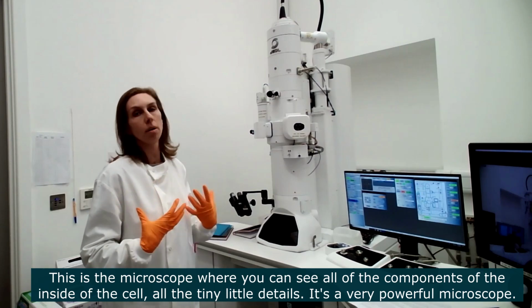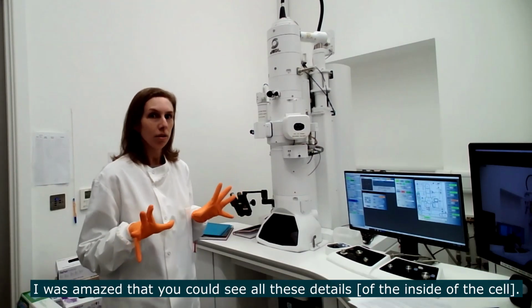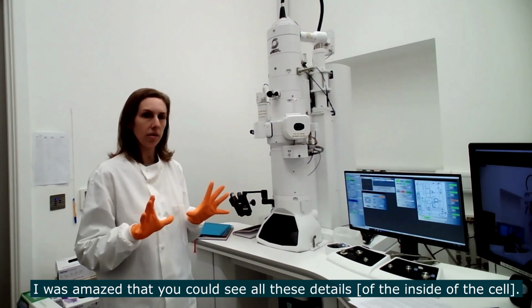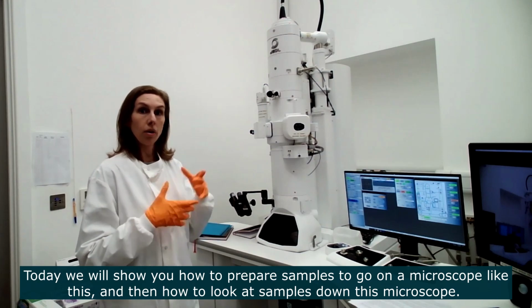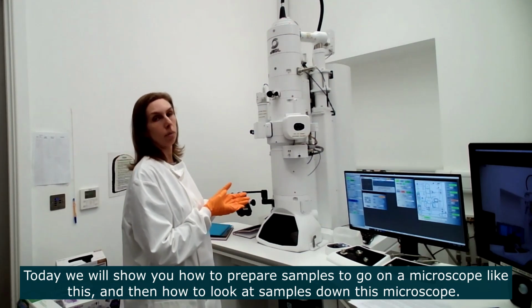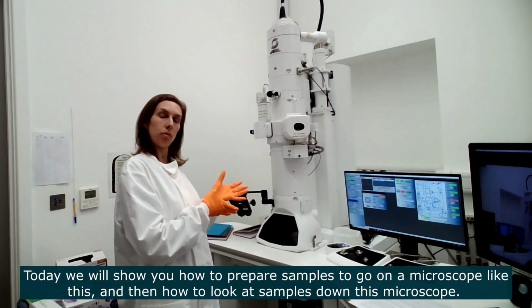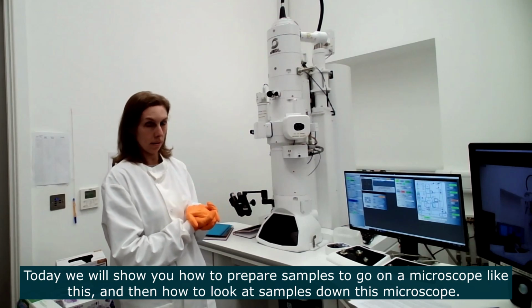This is a very, very powerful microscope, and I was completely in awe that you could see all these details. So today we are going to see what it's like to prepare samples to go onto a microscope like this, and then to look inside cells and tissues in a microscope like this.